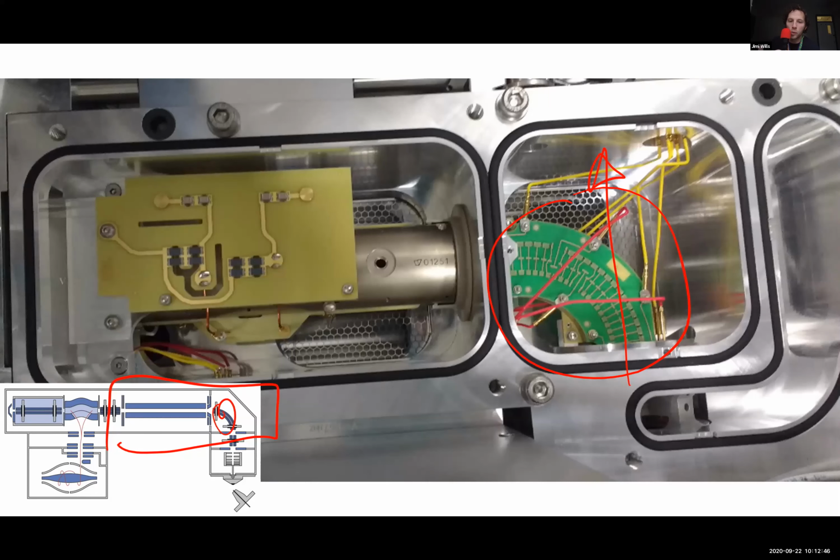I guess that's kind of important, because the next part is quite difficult to take out and clean. So the next part is the quadrupole. And this has many functions in mass spectrometry, but in this instrument, it's very specifically a mass filter. And it means you can select a particular ion of interest to take further into the instrument. If you want to, you don't always have to.